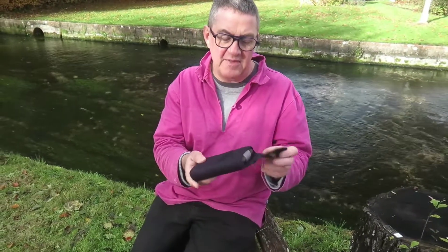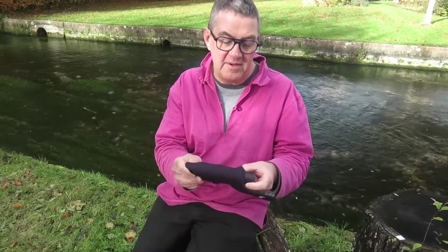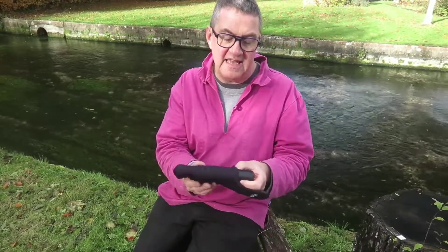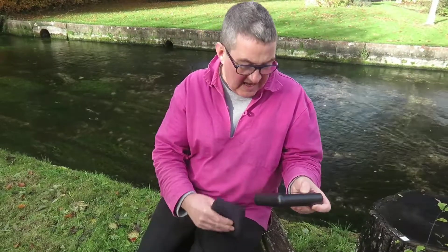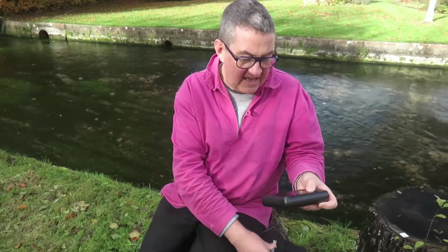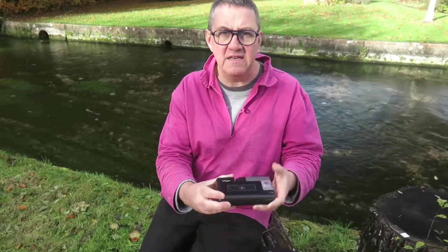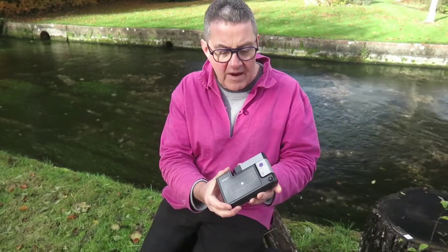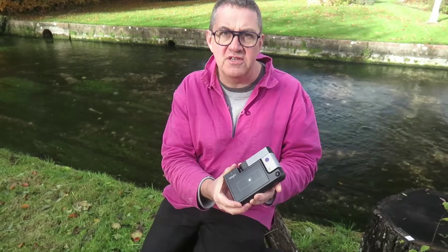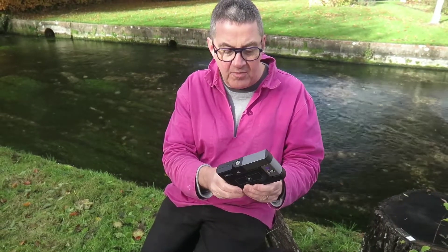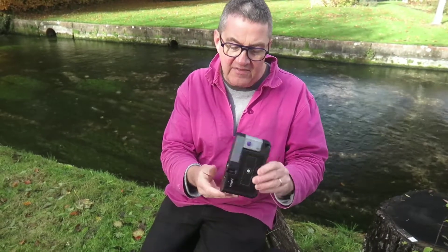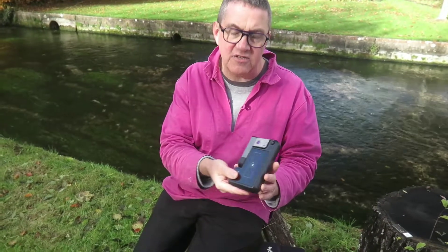Many people when they first get this microscope, they open it up and see how small it is and then they say, hey wait, where are the knobs? There's no focus knob and there's no XY stage.